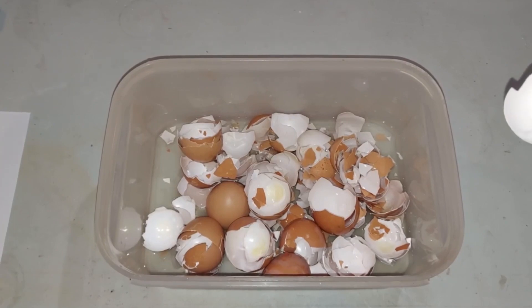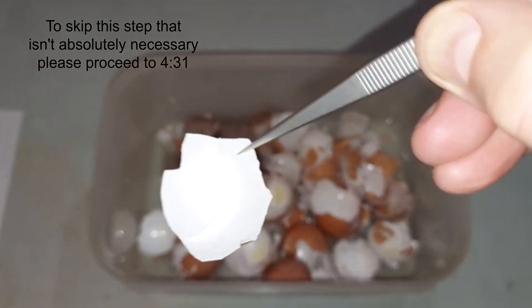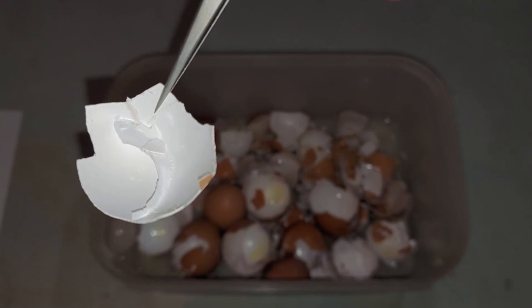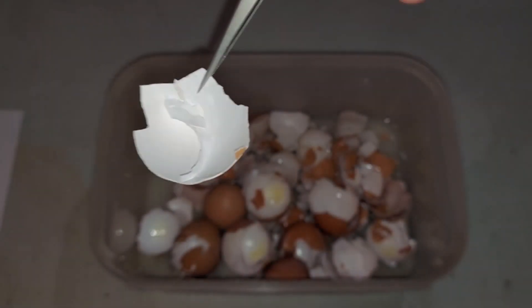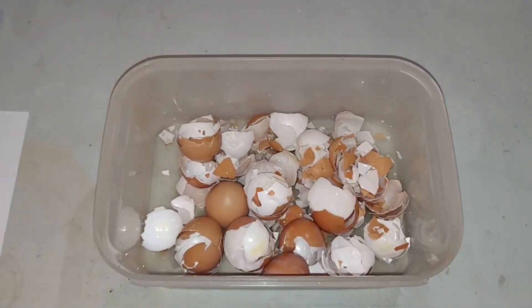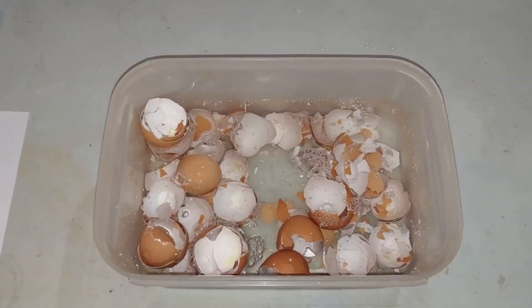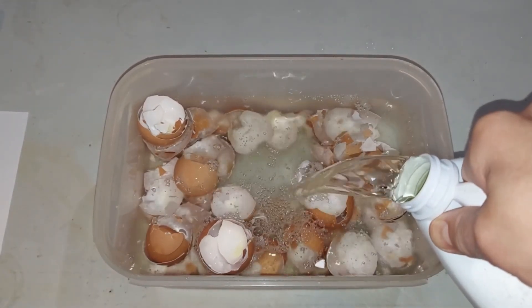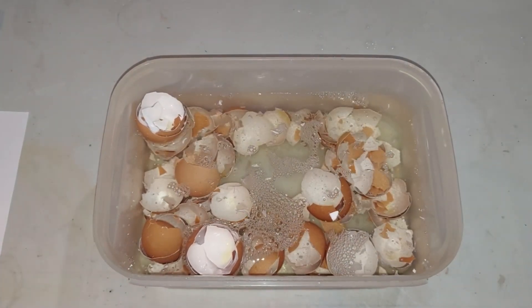Here are the eggshells I'm going to cover with bleach water. The reason is there's obviously organic material that's not part of the eggshell, and I want to dissolve that before we grind these up to make our calcium acetate. I'll fill with water mostly and add bleach — about 30 percent approximately — and leave them until I can see that the organic material has been dissolved.